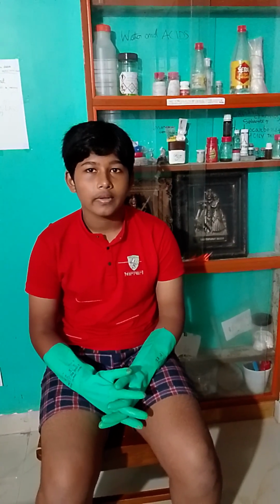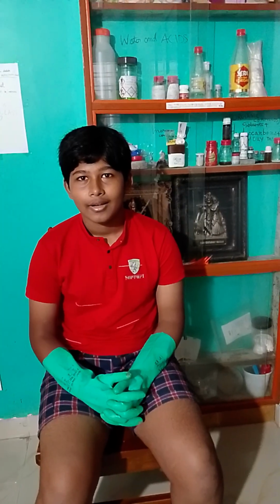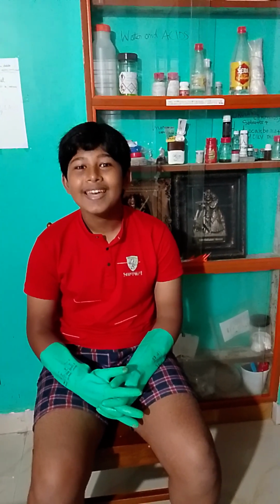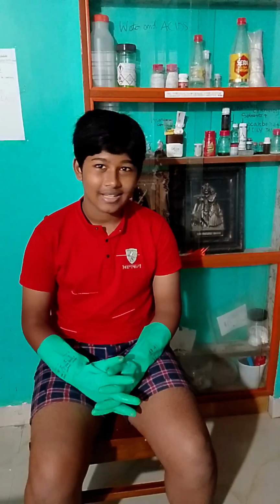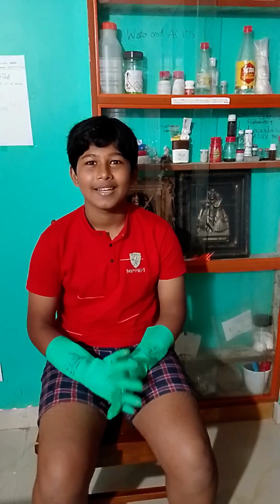Finally, all of the insoluble oxalate has fallen down out of the solution. So now I can finally extract the sulfuric acid, and I can show you that process and prove that it is sulfuric acid very proudly. Come on, let's go.